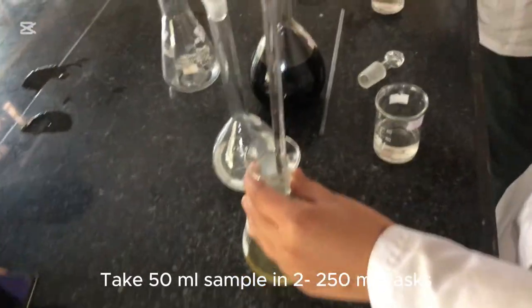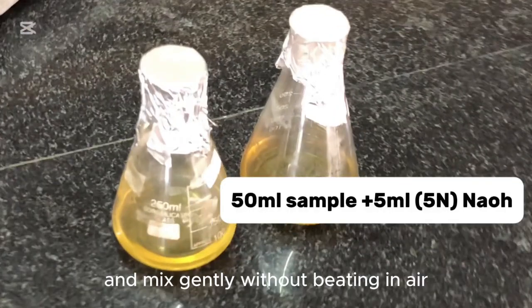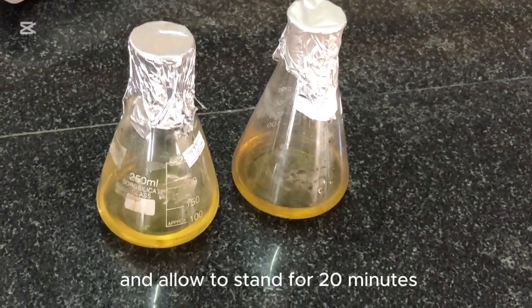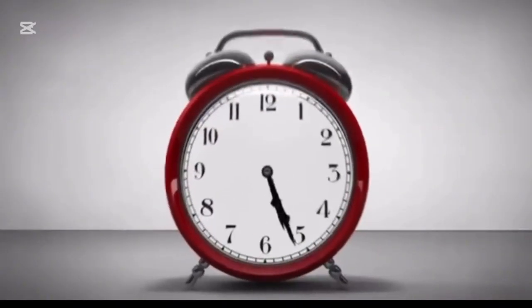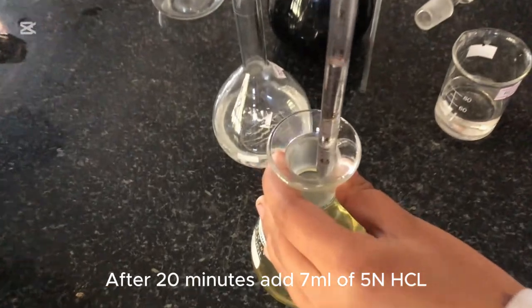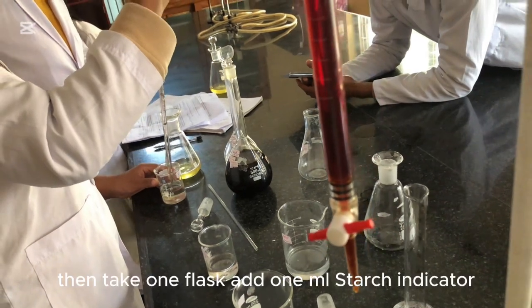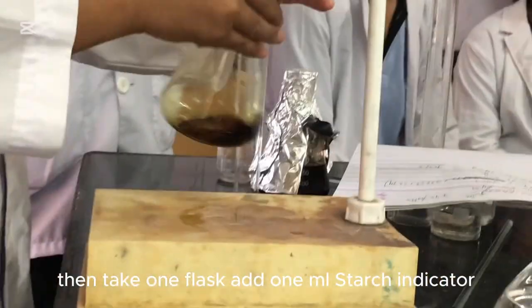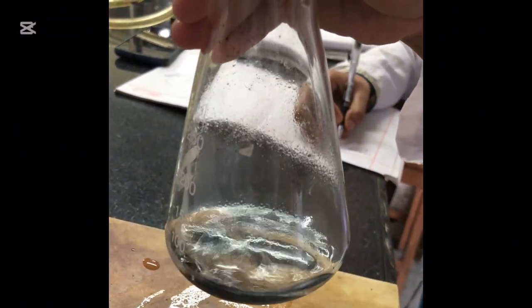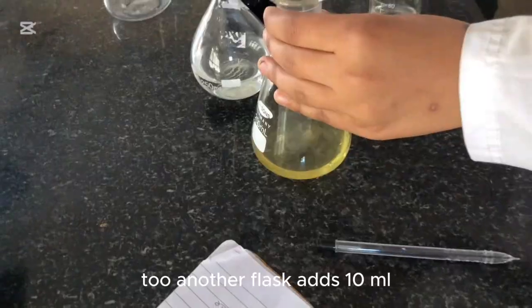Now determine total SO2 — free plus bound — in the sample. Take 50 ml of sample in two 250 ml flasks. Add 5 ml of 5N NaOH to both and mix gently without beating in air. NaOH is added to liberate the bound SO2; allow to stand for 20 minutes. Add 7 ml of 5N HCl and stopper immediately in both flasks. Take one flask, add 1 ml starch indicator, and titrate immediately with 0.02N iodine solution to a blue endpoint. Let the titer be C.